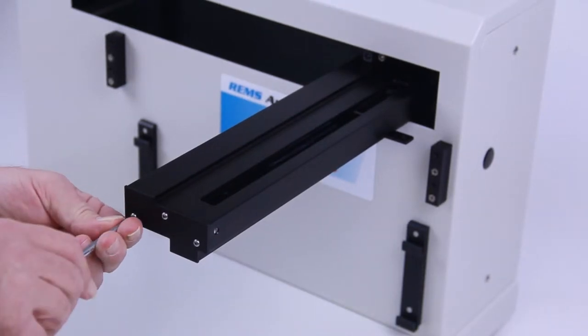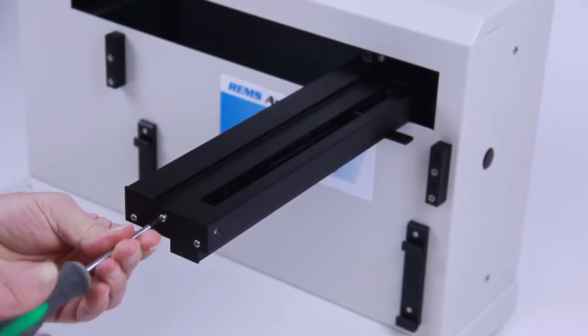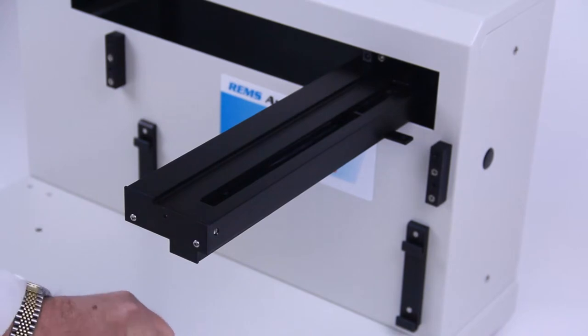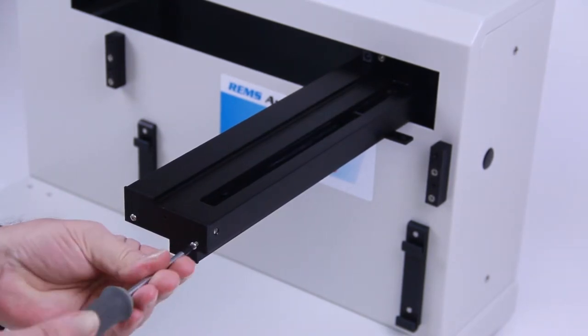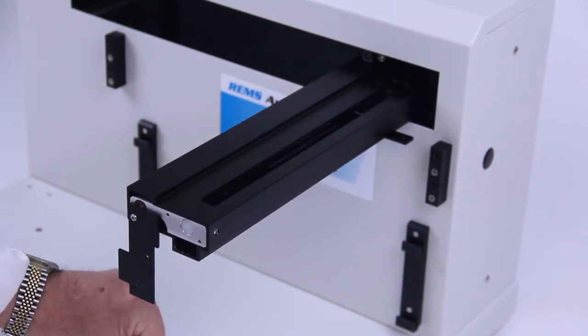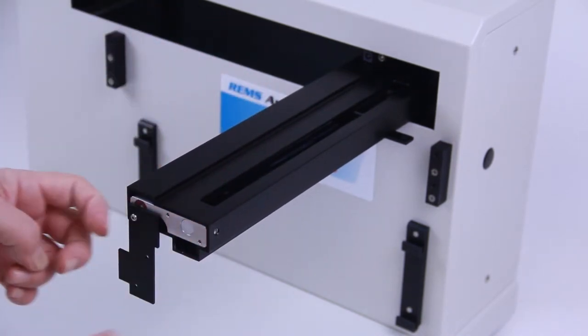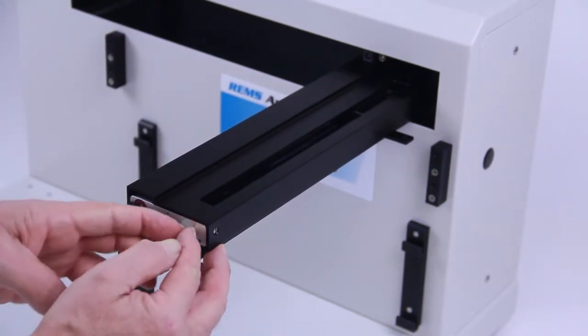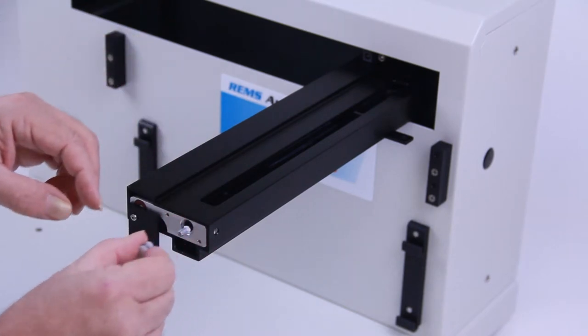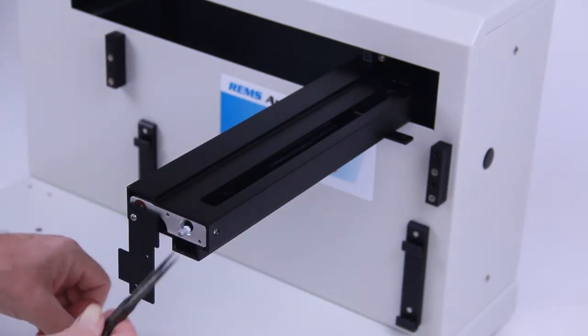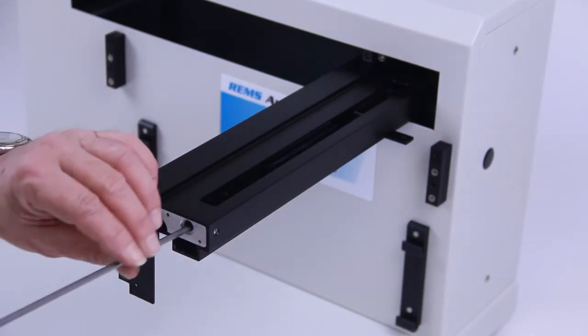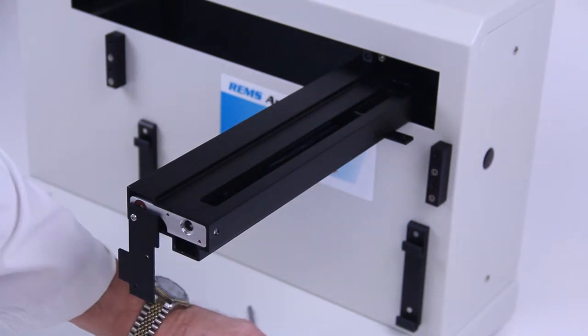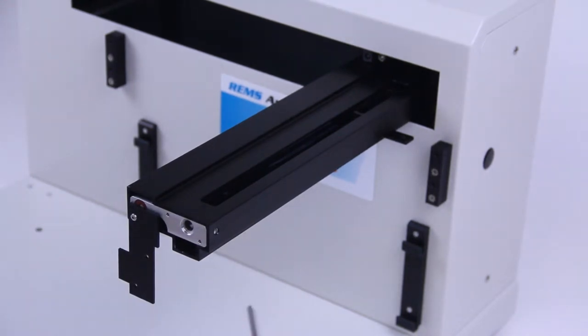To attach the vertical arm, first unmount the cover plate from the front of the horizontal arm by removing two of its three screws. Use your finger to press on the control rod within the horizontal arm and move it outward. The white plastic plug and control rod will move forward slightly, allowing you to remove it and the control rod from the horizontal arm.